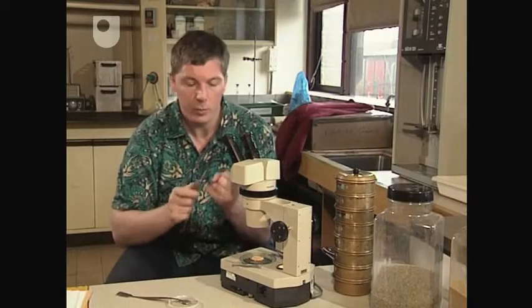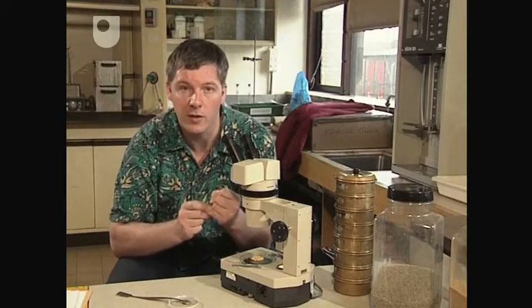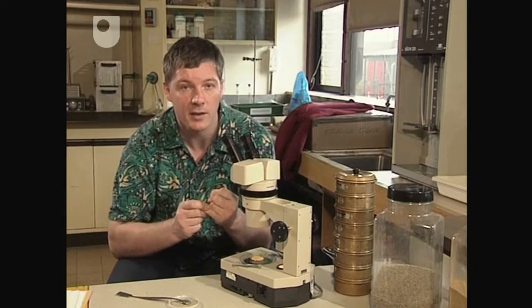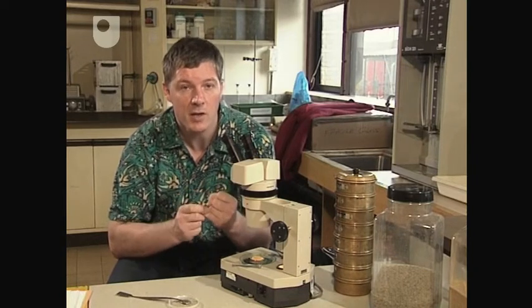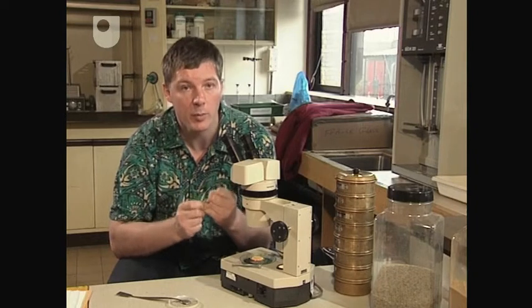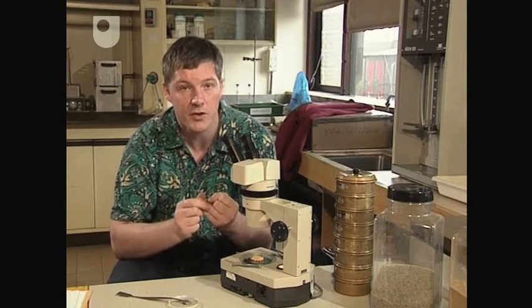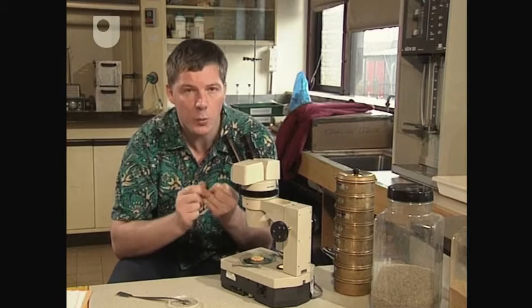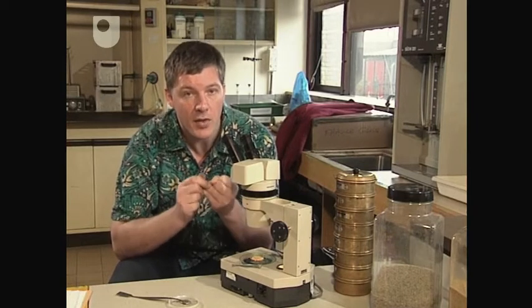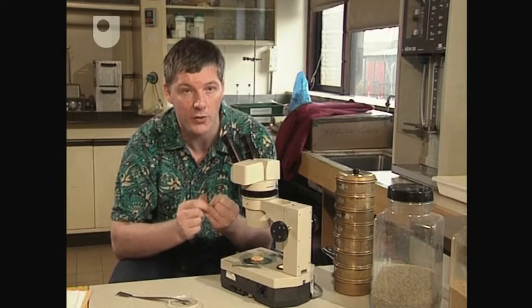Already, we've got two vital pieces of evidence from these quartz grains. First of all, shape — they are angular, and that tells us that they have not been processed for very long; otherwise, they would be more rounded. Secondly, we have surface texture — these quartz grains have glassy, reflective surfaces, and that tells us that the main transporting medium was water.